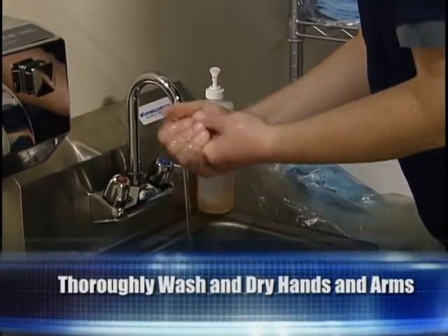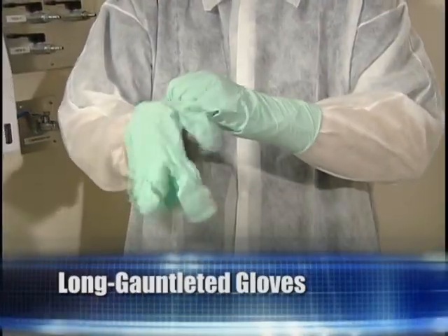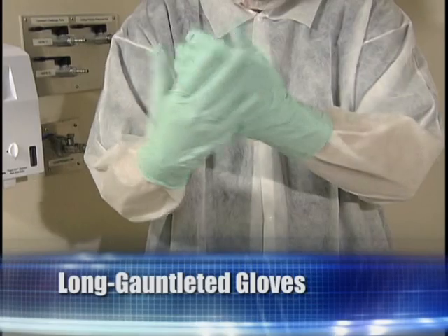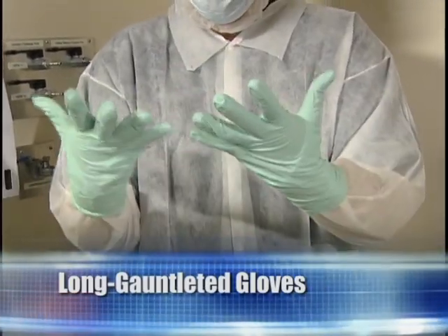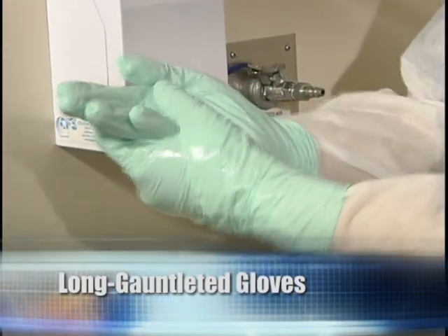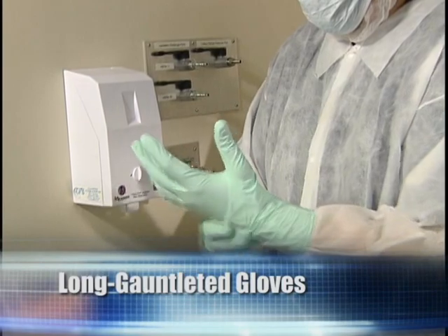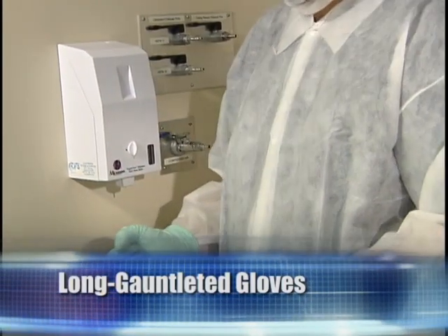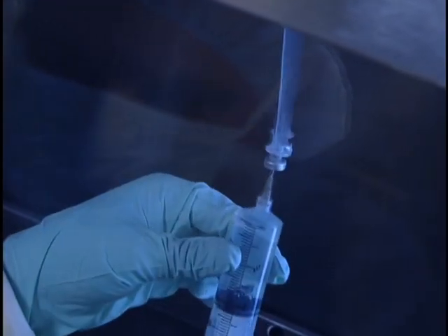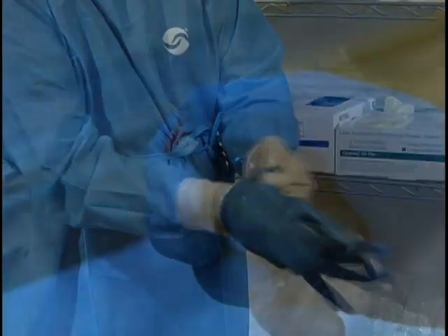Thoroughly wash and dry hands and arms to the elbow according to the standard procedure. Appropriate long gauntlet-style gloves should be worn. The gauntlet of the glove should be pulled over the cuff of the gown. Because of concerns related to latex allergy of both the patient and the compounding personnel, some institutions are now using latex-free gloves such as nitrile for all IV compounding. For hazardous drug compounding, wear double gloves, one set of standard gloves first, and then a set of chemotherapy-appropriate gloves.